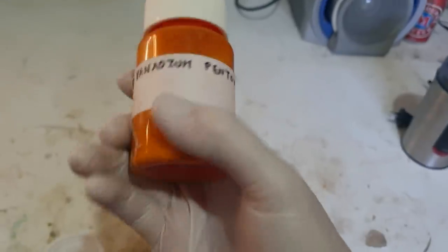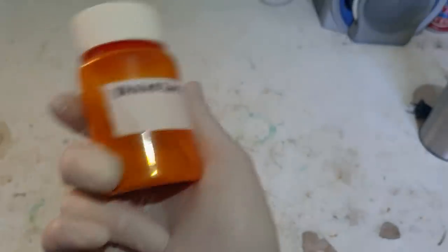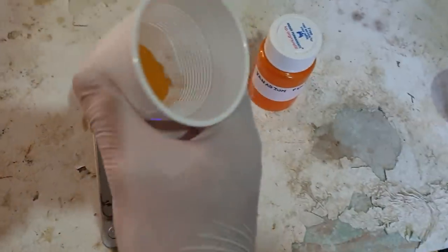So this time, if we just try a little harder to slow down the rate of the thermite reaction, we might be able to get nice big lumps of metal rather than just spraying lumps of metal across everywhere and get a lot of yield from it. Alright — 31 grams of this wonderful orange powder. It's pretty dense and a very interesting color.